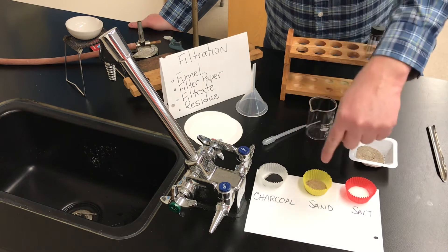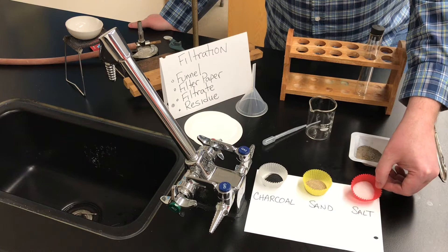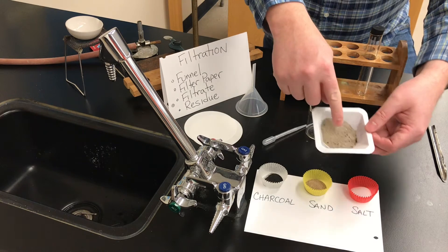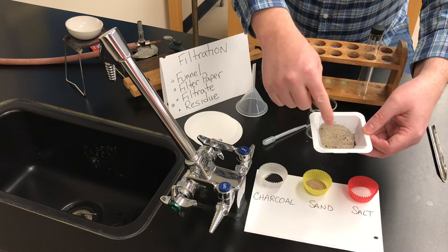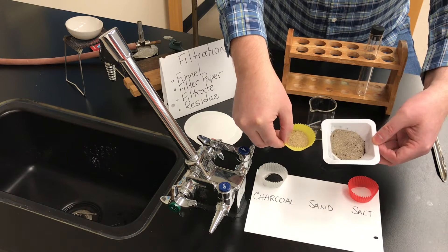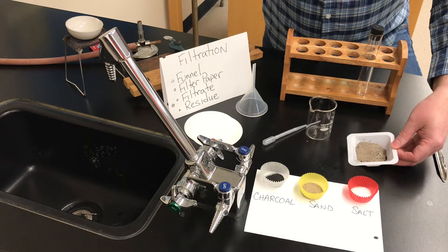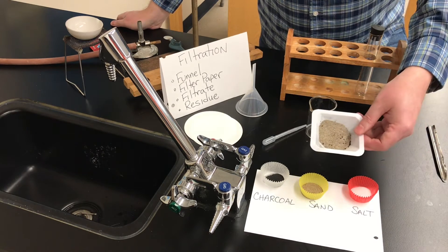So we have charcoal and sand, and then we have table salt — sodium chloride — white table salt. These three substances have been mixed together into this mixture. You can see there are little bits of black solid in there. There are some large pieces of charcoal, and the sand looks a little bit darker, a bit grayer than normal, because of the charcoal. It's hard to see, but there is some salt in there as well.